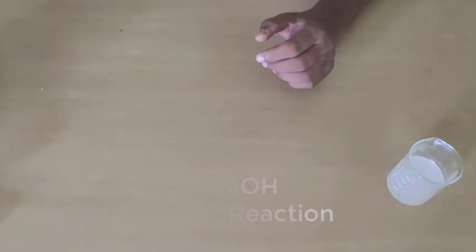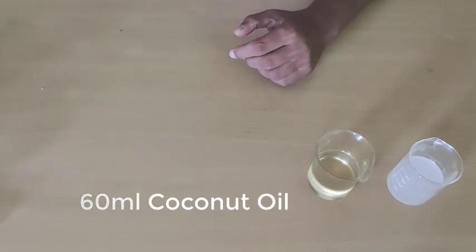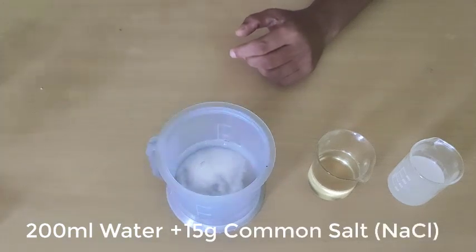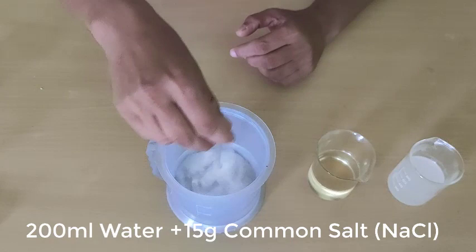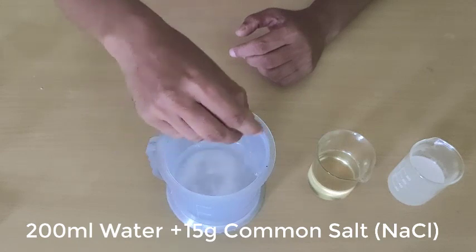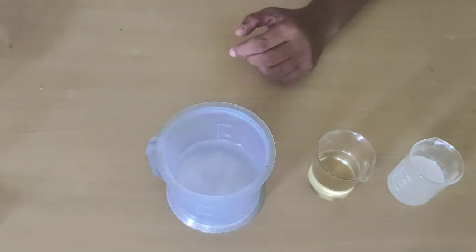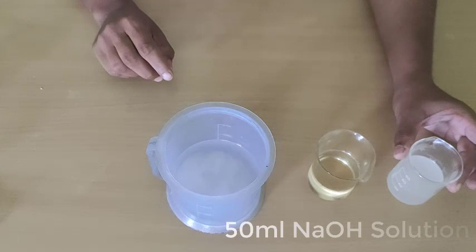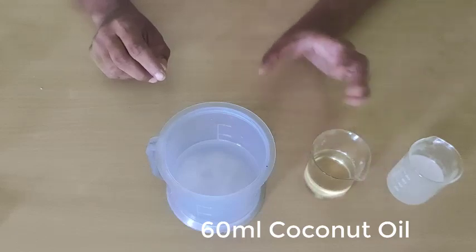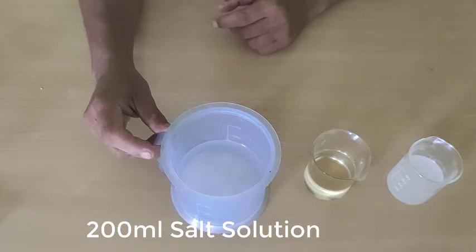Along with this, we will use 60 ml coconut oil. In this jar I will mix a salt solution — I have taken 200 ml water and added 15 grams of salt, that is sodium chloride. So we have: 60 ml coconut oil, 15 grams sodium hydroxide solution, and 200 ml water in which 15 grams of salt is dissolved.